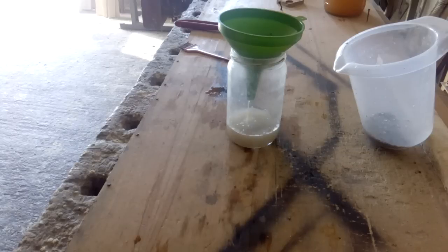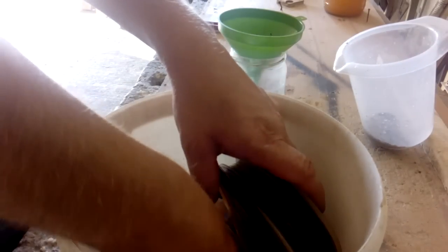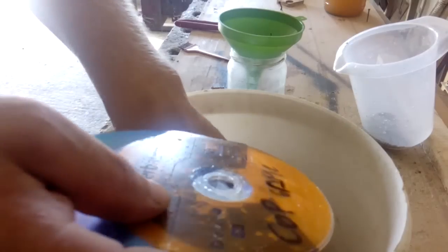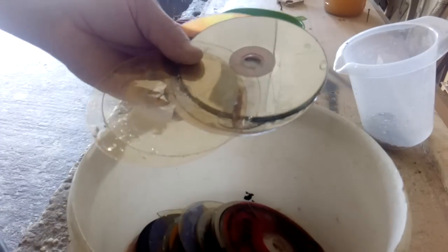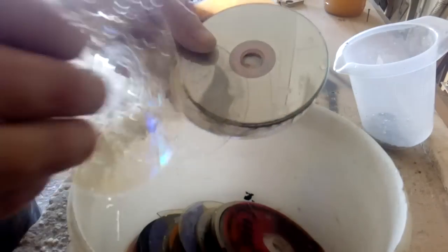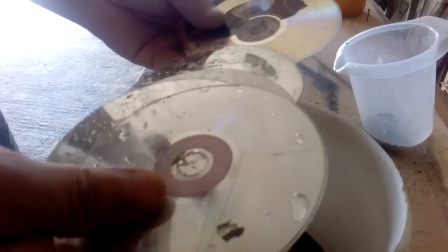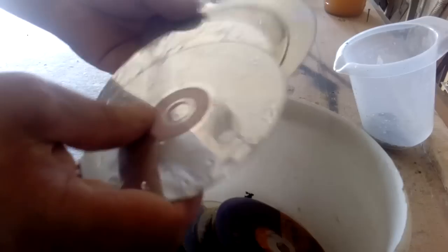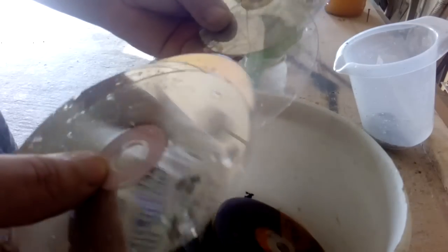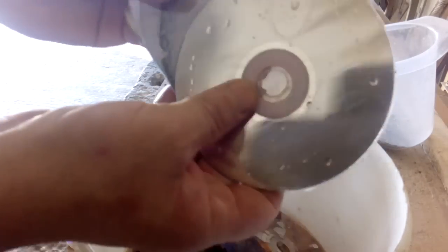And what we got here is a full bucket of discs. I cleaned these so I could touch them with a bare hand. I got a couple of these discs which I'll leave for some other time. We need to count: one, two, three, four, five, six - this is not much - seven, eight. So eight discs make a problem.